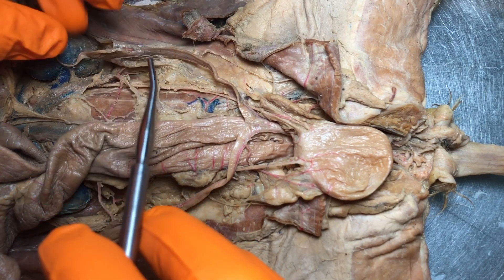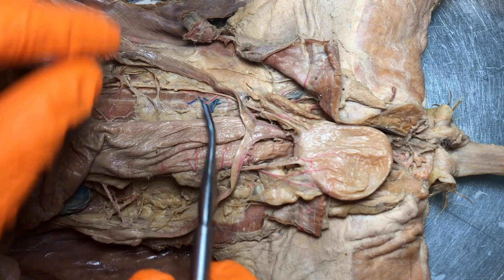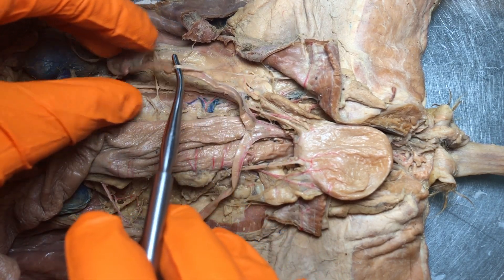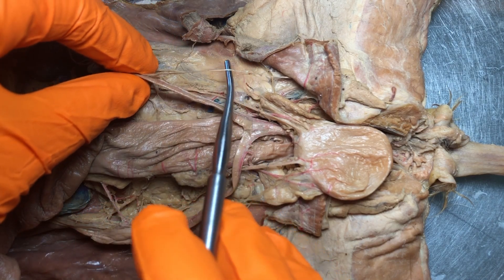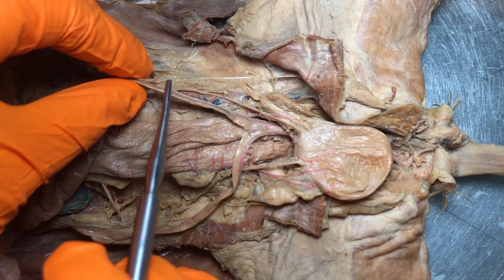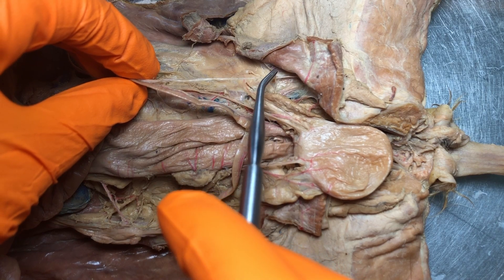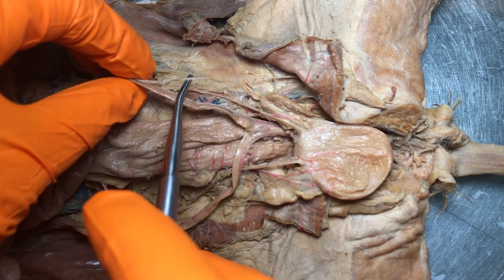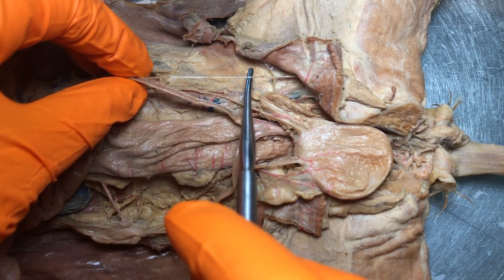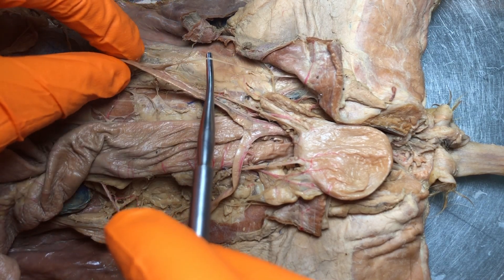There are specific parts of the broad ligament up here, but you don't need to know those parts. Down here on this uterine horn we have another ligament — that's going to be the round ligament. A way I like to remember this is that the round ligament is in the same area as the inguinal canal and spermatic cord on a male cat. So the structure in that similar area on a female cat is the round ligament — this would be the left round ligament.